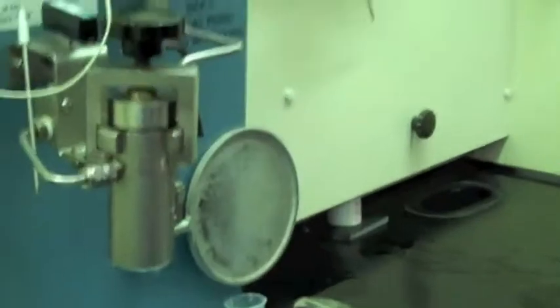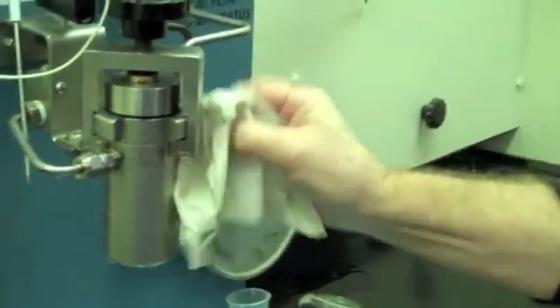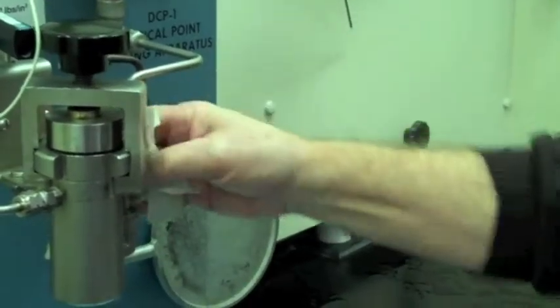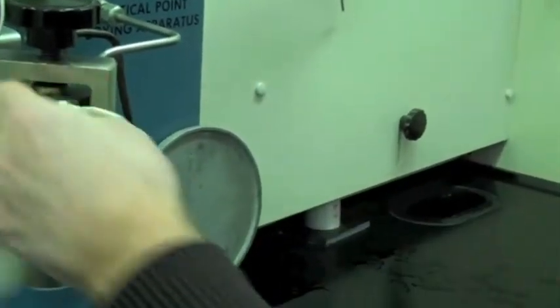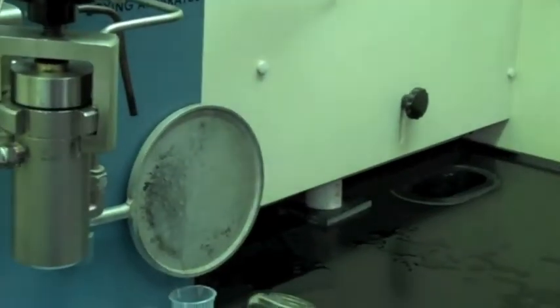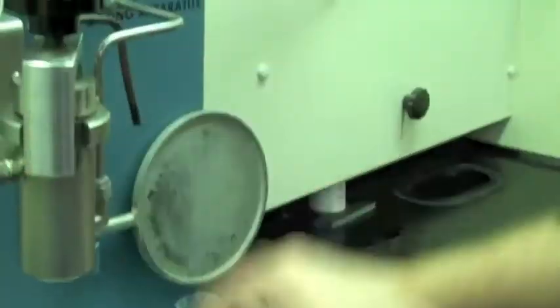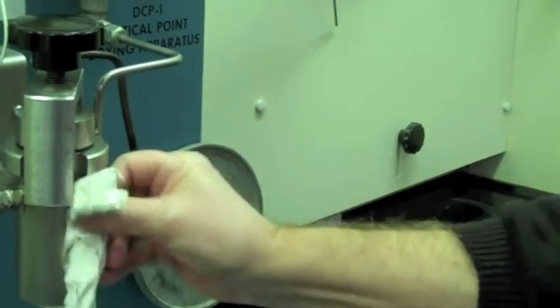And then dry off. And I sometimes use these to dry the whole thing off. And we don't want to drop any water in it now since we just eliminated liquids. And invariably have some under these flanges.